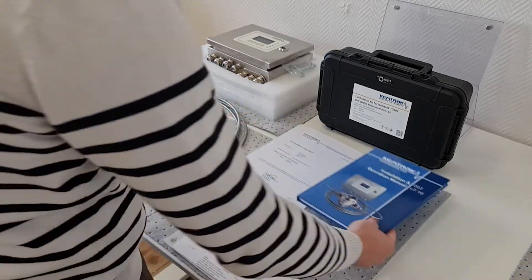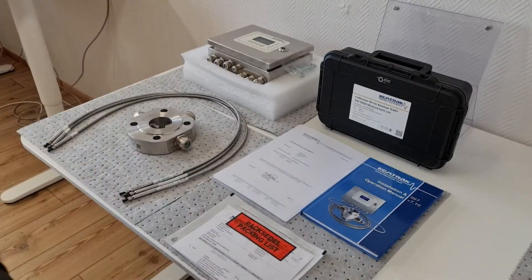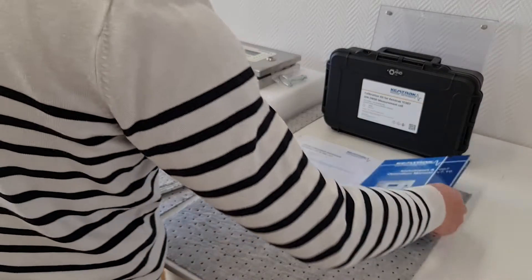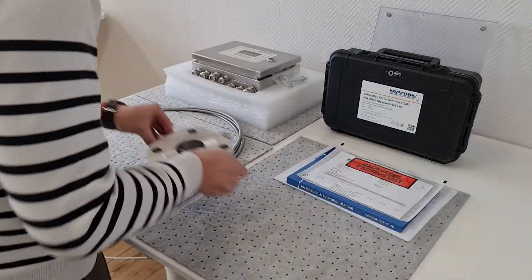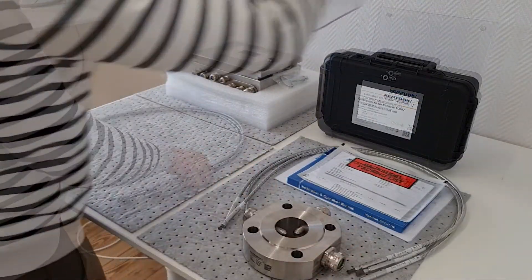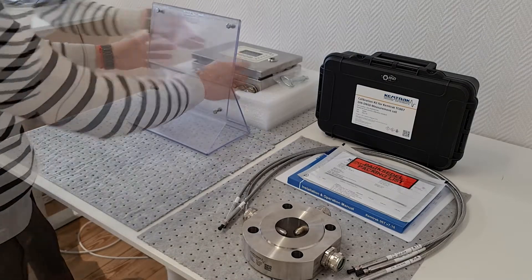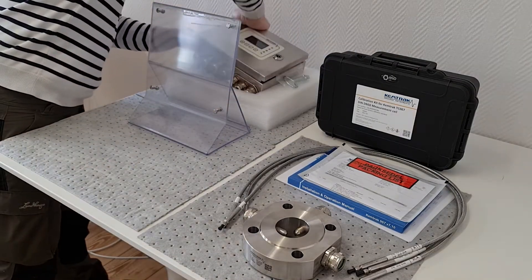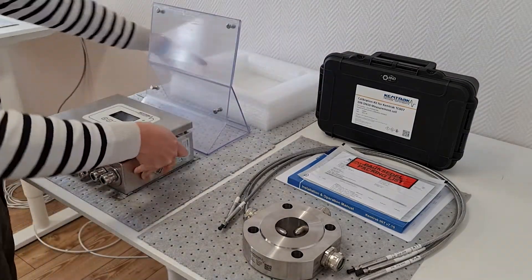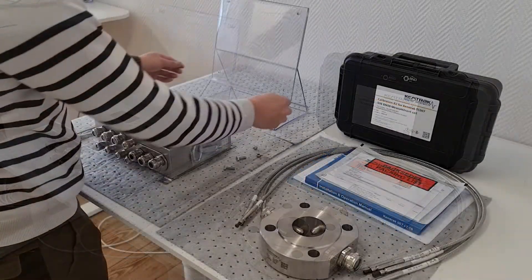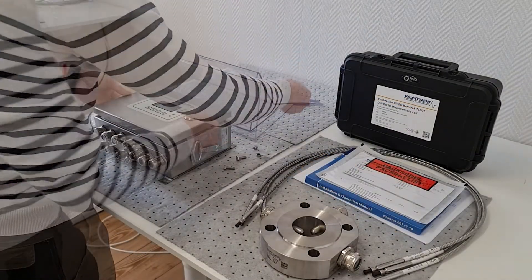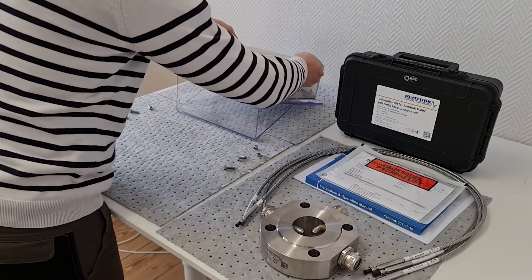The order is complete with a hard cover installation and operation manual. The next stage will be to assemble the system. The order shown on this training video comes with an optional polycarbonate display stand that allows ease of use on a benchtop environment. We will begin by attaching this to the analyzer enclosure.